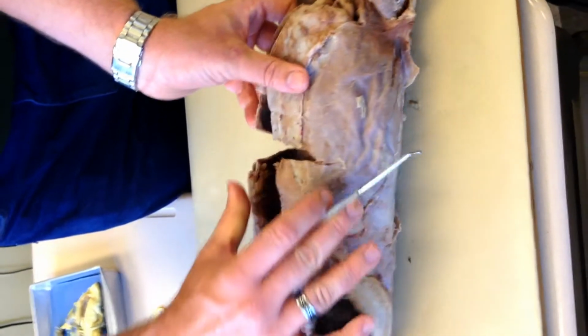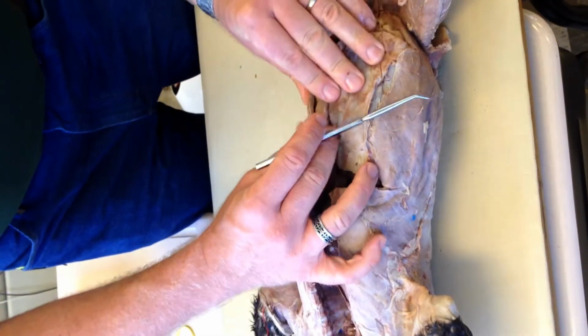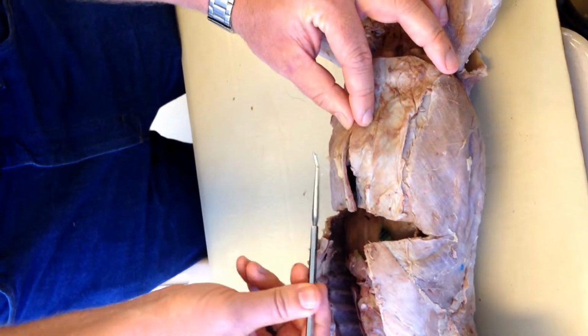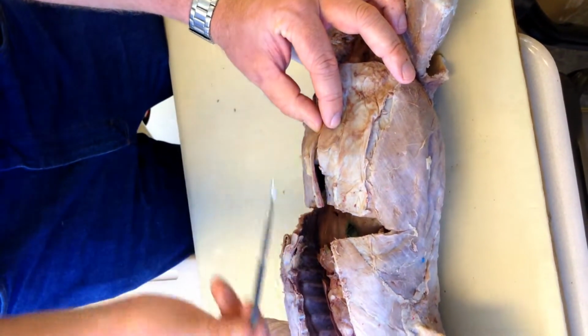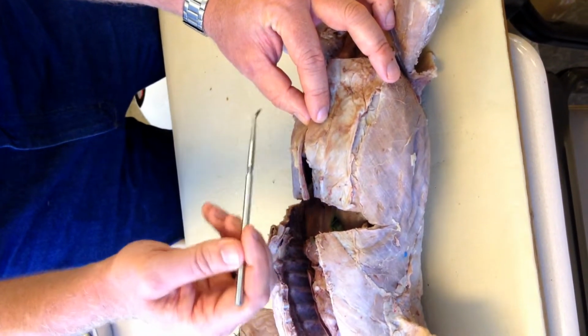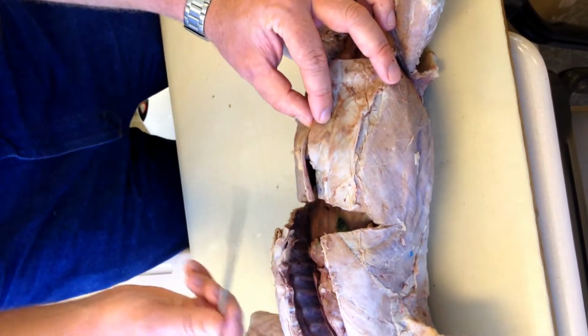27, I'll try to keep the cat together here. 27 is the muscle that you cut in half to enter the abdomen. It's right here, and it runs the length of the abdomen from right into the rib cage down into the pelvis. In you, it's what gets all ripply if you do too many sit-ups. 27.